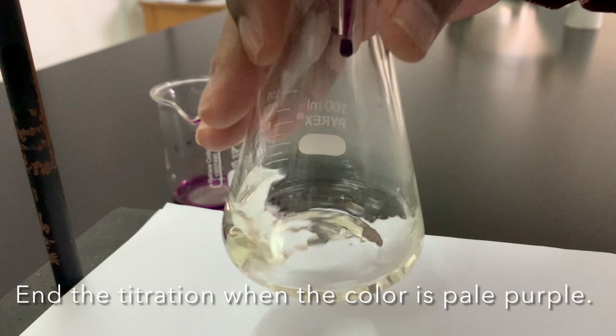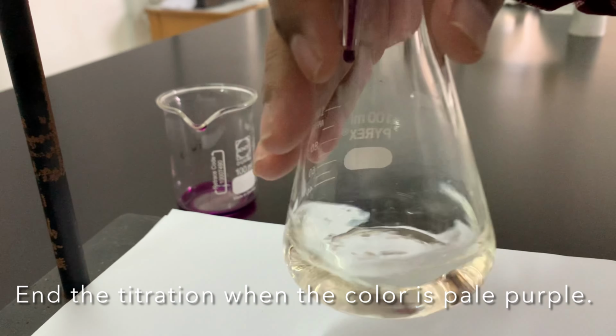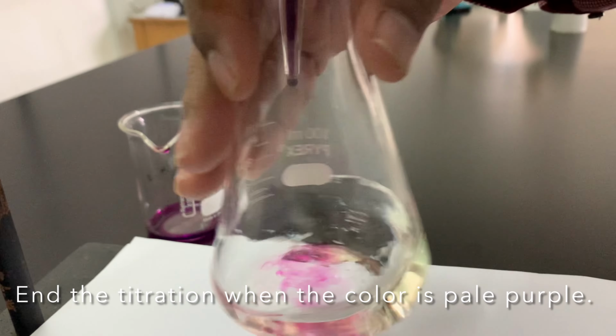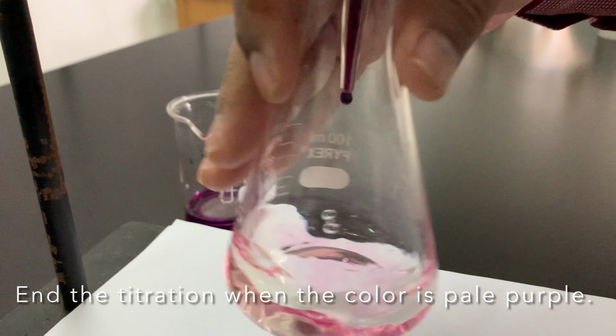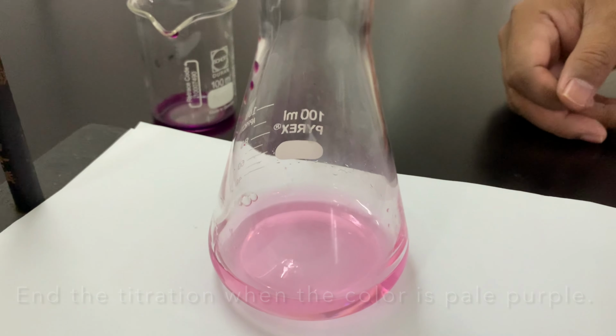The titration will end when all iron has reacted. This means that there is no more iron 2 reacting with permanganate. The observable color at the end will be the color of permanganate, which will stay purple.